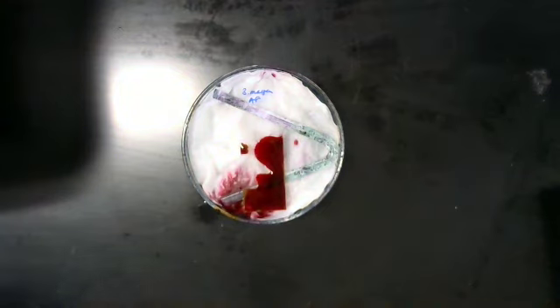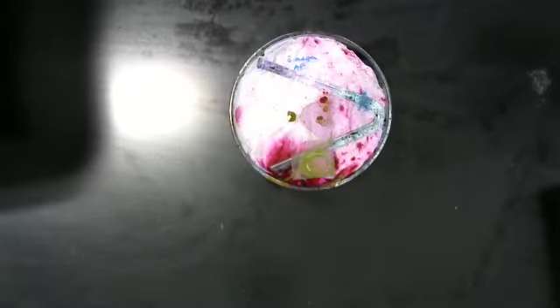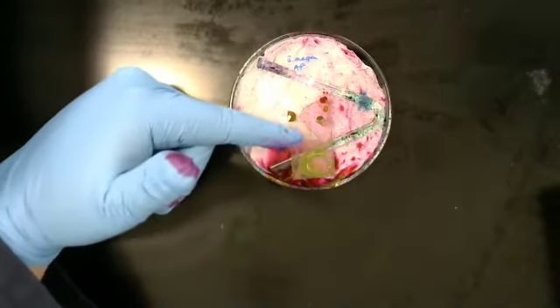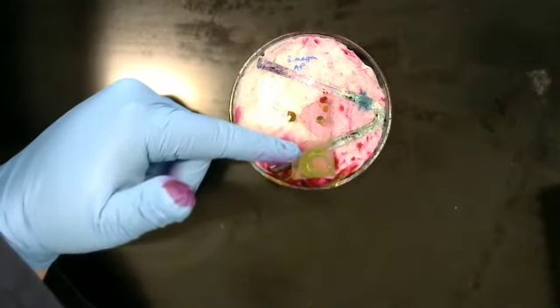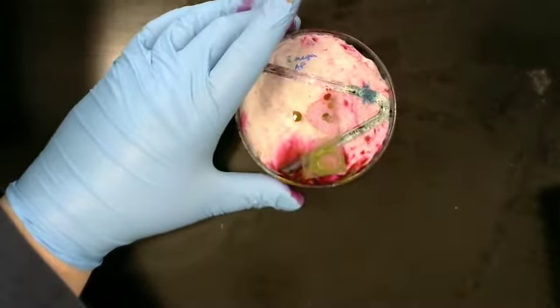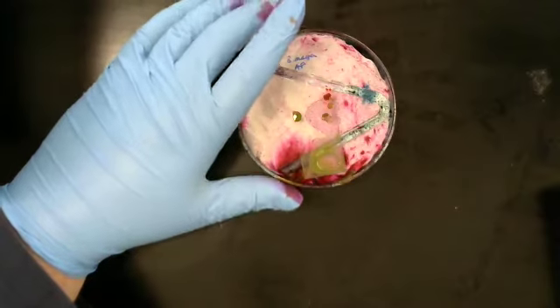And we are now going to take this over to the microwave and cook it. And now that we're back, you can see that the slide is more metallic. That's what happens when you heat up carbolfuchsin. I did leave this in the microwave for about 15 seconds after I opened it up.